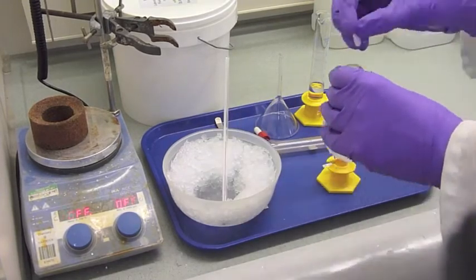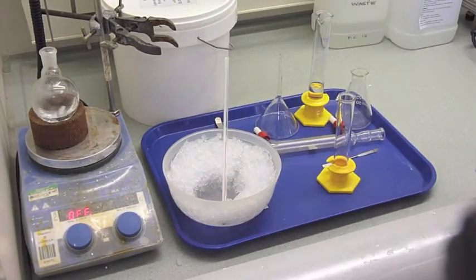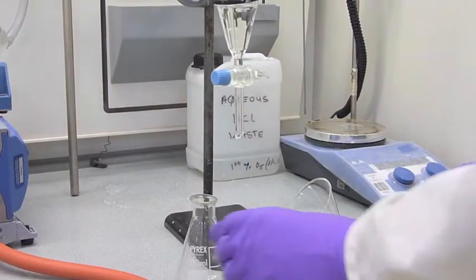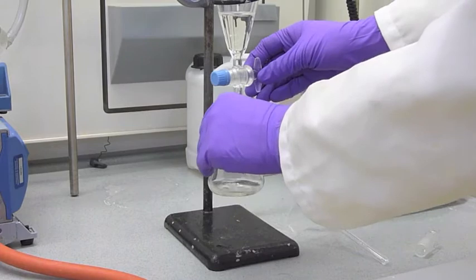Mixed t-butanol with cooled hydrochloric acid in a round-bottom flask. Separate the layers, and then discard the acid layer.